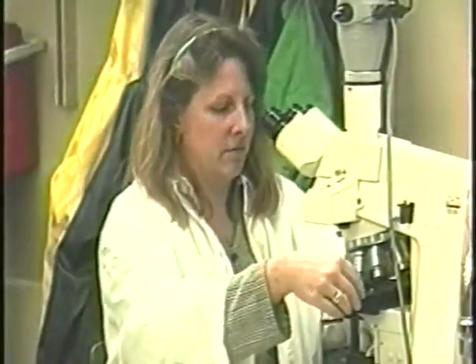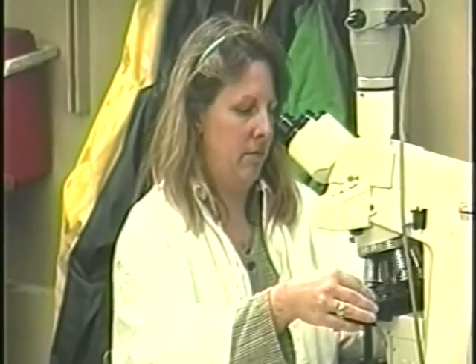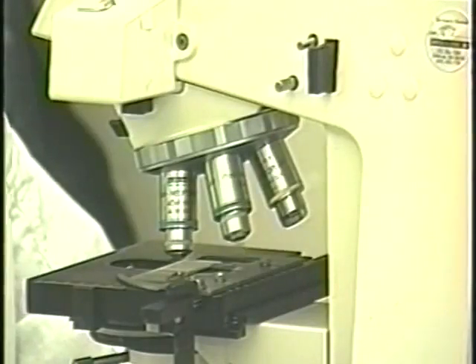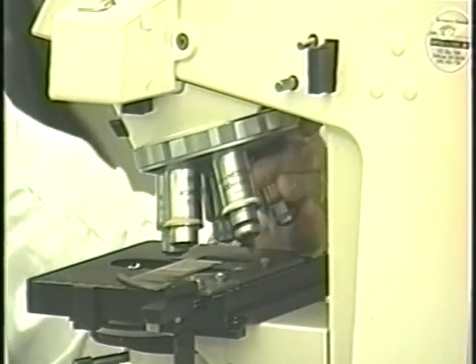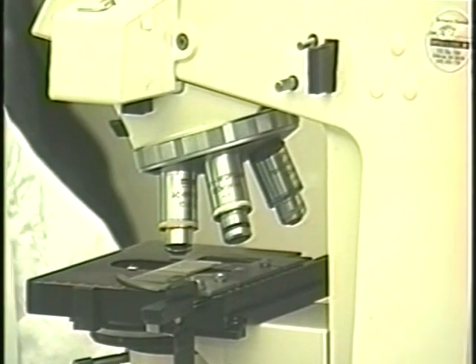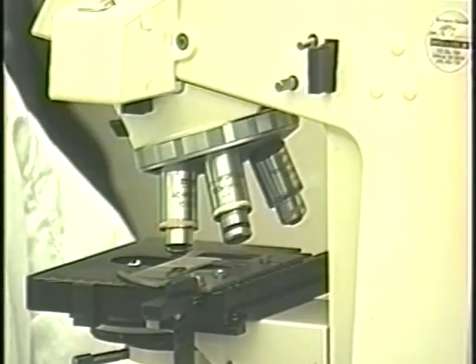Samples taken from the gills and body surface should be examined immediately under a microscope by scanning first at low power, or 100x total magnification, and again at medium power. Use of the high-power oil immersion objective is usually impractical because of the thickness of the samples, but bacterial infections can often be detected at lower magnifications by looking for bacterial colonies in areas with pathology.